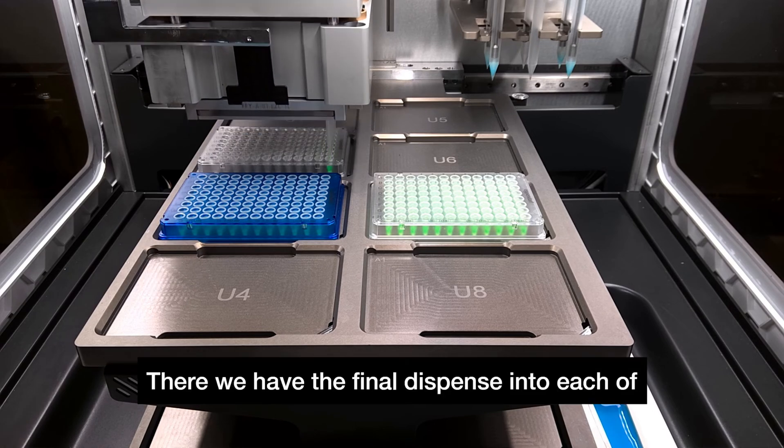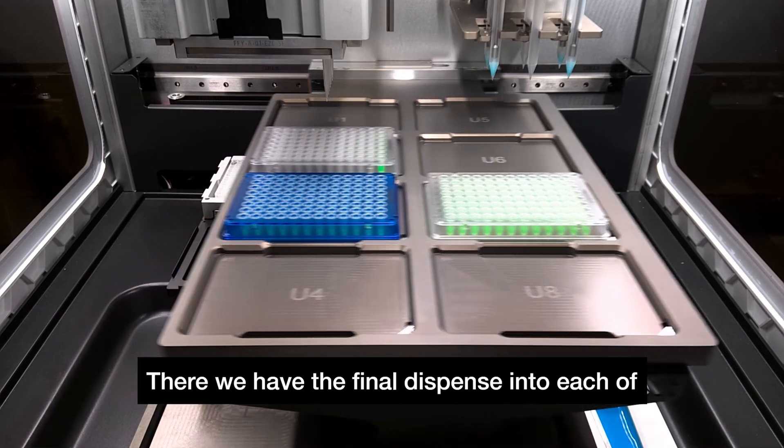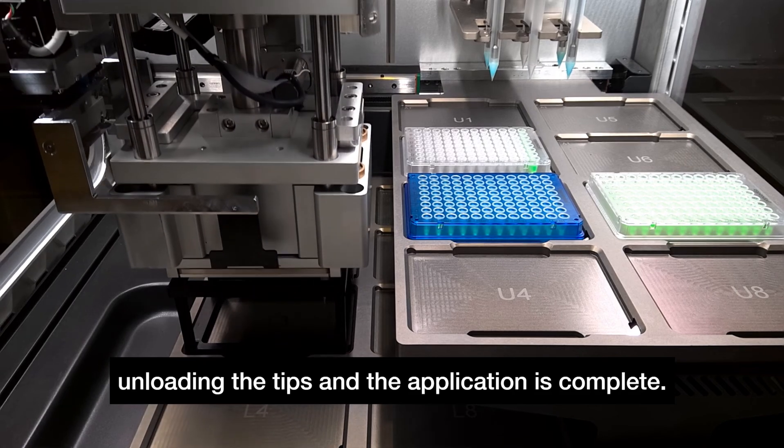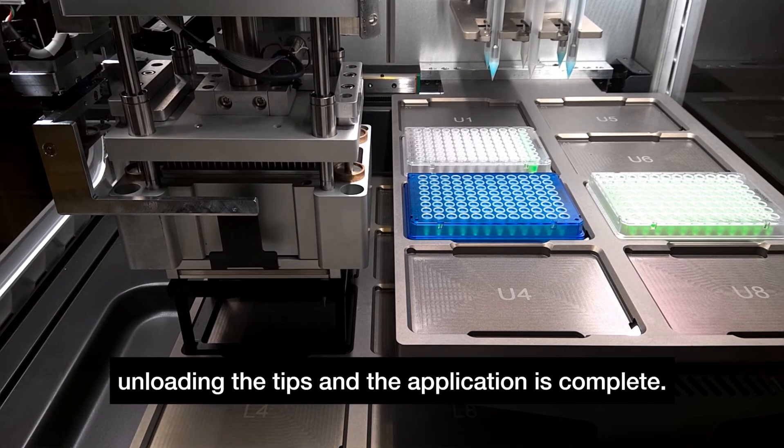So there we have the final dispense into each of the wells in the last column and then finally unloading the tips and the application is complete.